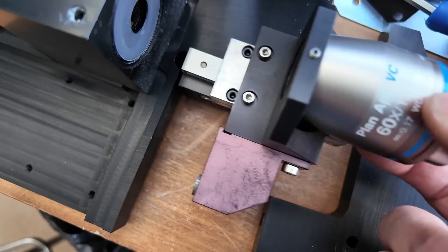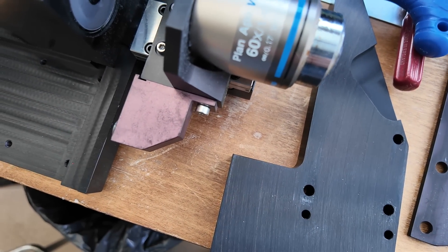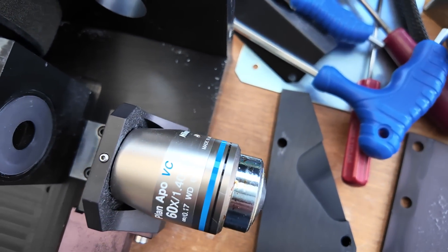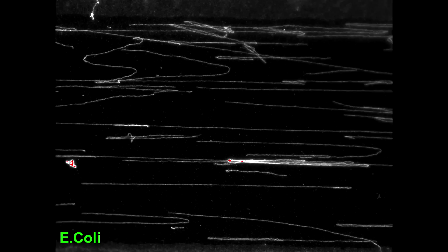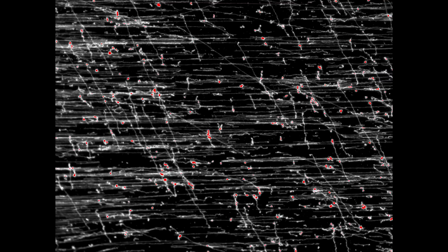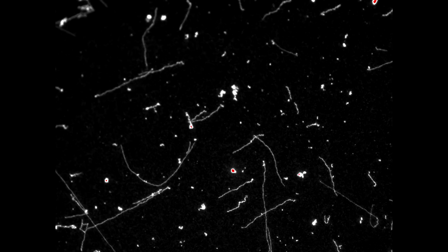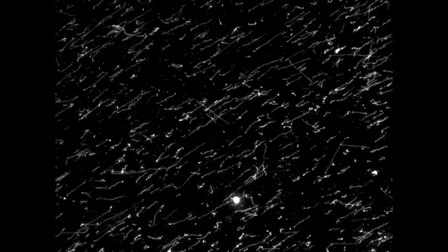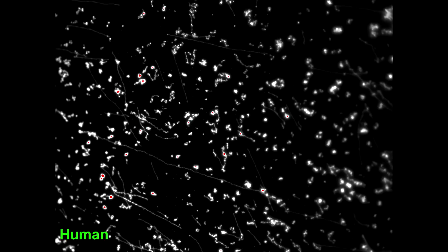So this little precision slide mount — my eBay username is the same as the YouTube channel name. A few bits out of this will probably be going up over the next week or two. Here are some of the images I've pulled off the discs on this thing. I've no idea what these mean — some of them seem to have some sort of colouring on them. Where the file names look like something obvious I've just put that as a caption on the picture, but I have no clue what these are supposed to mean or how you're supposed to interpret them. If anyone has used this sort of system and has any clue, please add it to the comments so we can figure out what this thing is actually doing and how it makes use of these squiggly, wormy pictures.